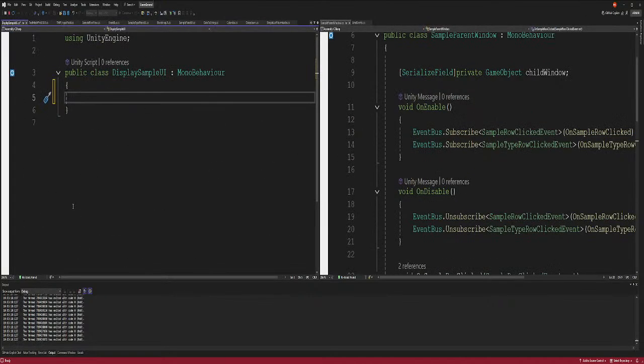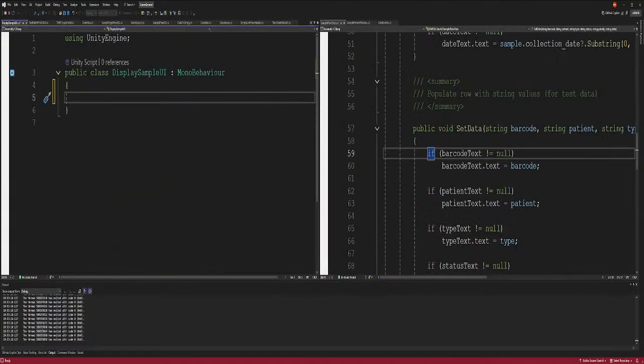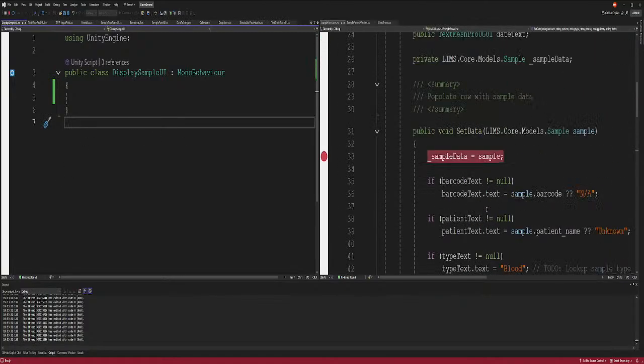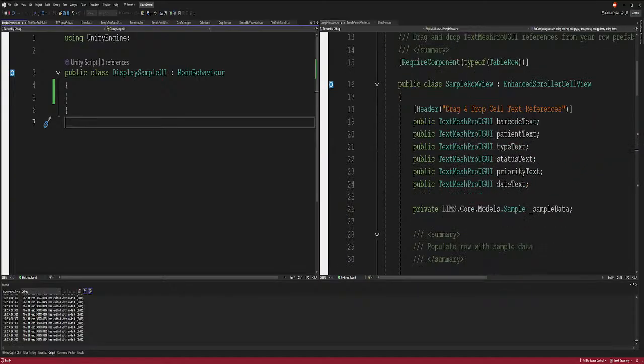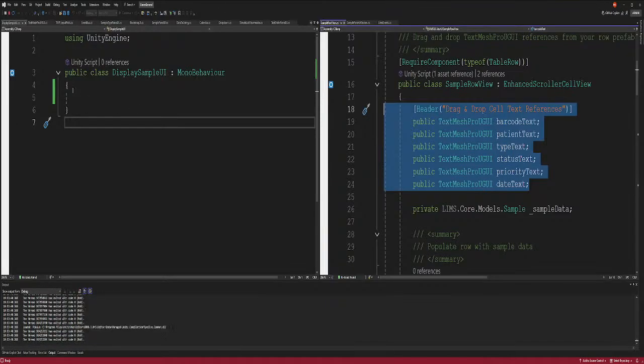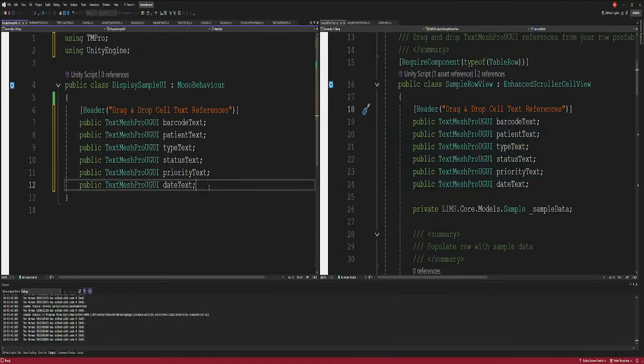So right now, we are only sending this bit of data. Correct. We have to rework a lot of this stuff, but we'll get through it. So I'm just gonna copy and paste that right here. All right. So then we got that right.